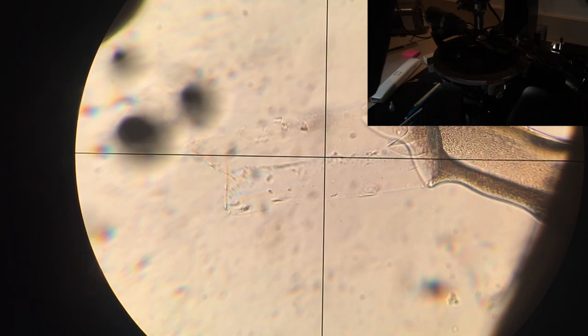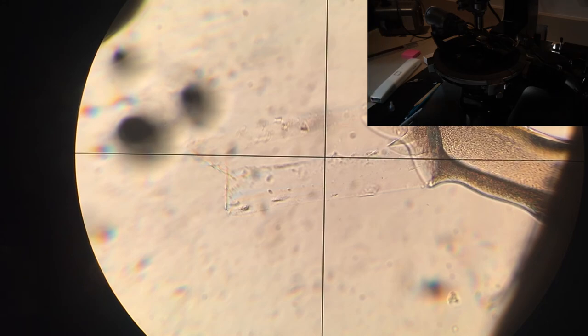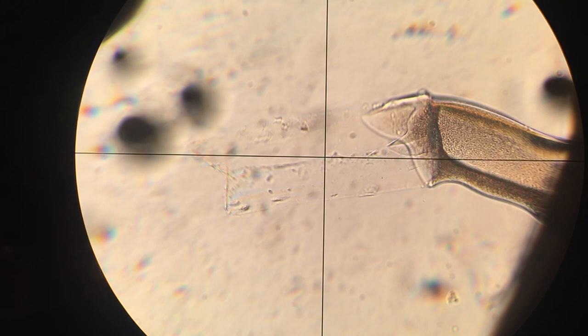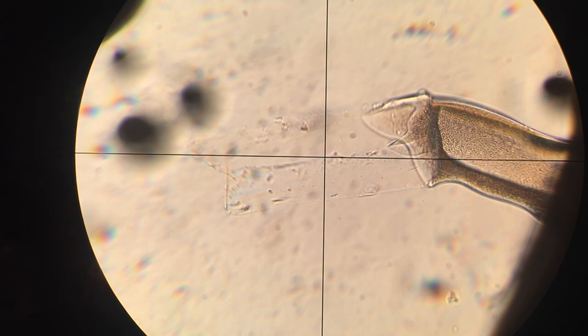That's refractive index measurement. I would do the same thing with different orientations. So I do the same thing for beta and a different liquid. Use the spreadsheet to keep track of all this stuff because it's kind of confusing or it's just hectic to keep track of temperature and wavelength and refractive index and looking at it. So that's it for measuring the optical properties.